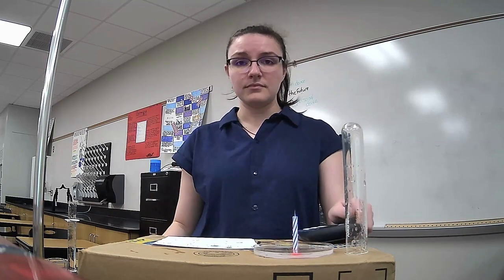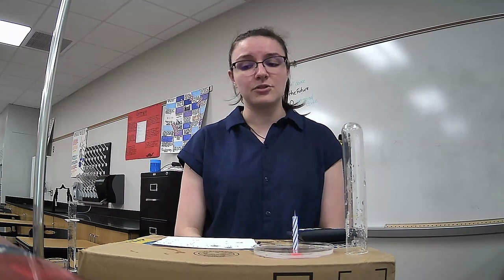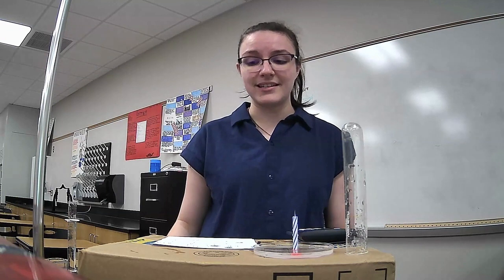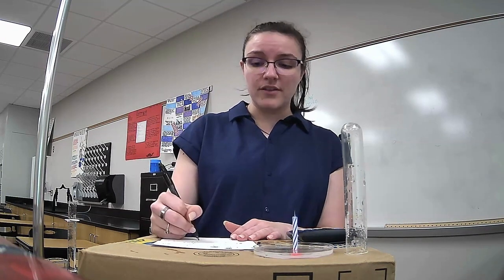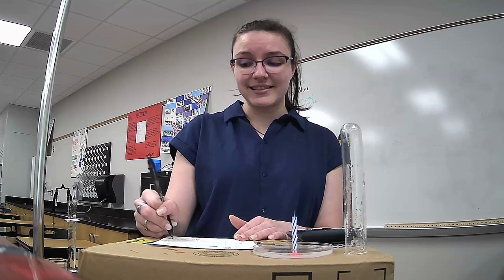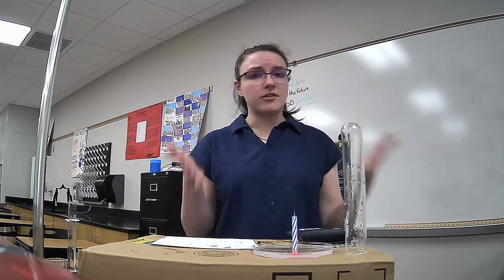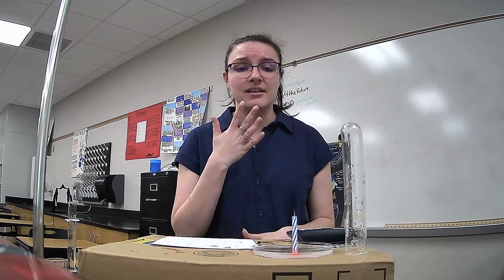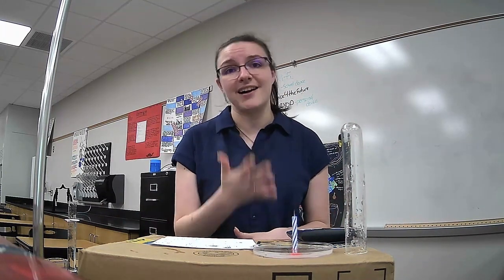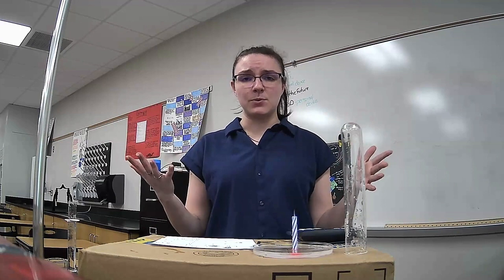28.3%. So I've got 26.7%, 25, and 28.3%. If I average all of those together, I get 26.67%. So I found across 3 good trials that the volume of oxygen was 26.67%. But I said at the beginning it was 21.